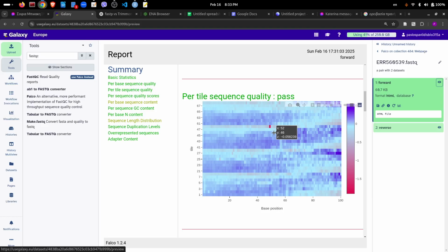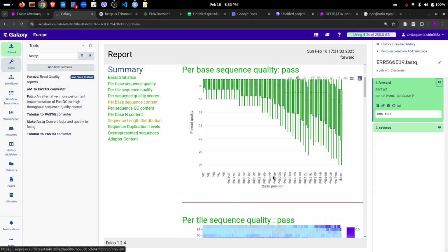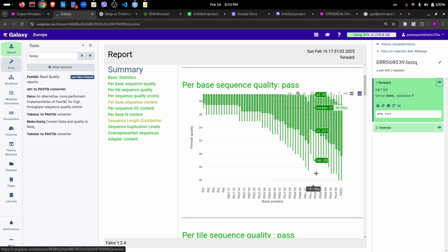Okay, so the report of Falco, the report of FastQC is similar, and now we can see the results after I have done some filtering that I will explain a bit later. So what we see here is on the x-axis the positions of the reads. Our read goes from position 1 to position 100. And on the y-axis we see the quality of the sequencing. So here we have done some filtering, and what we observe is that even at the end the read quality is quite high, above 25, 26 actually. It's very high. So that's why we see green colors here. Everything has passed the quality filters.